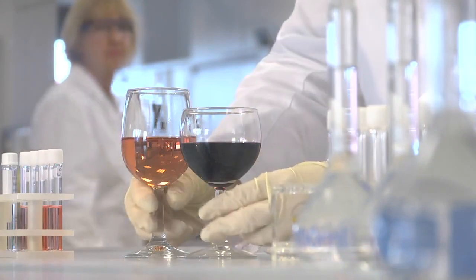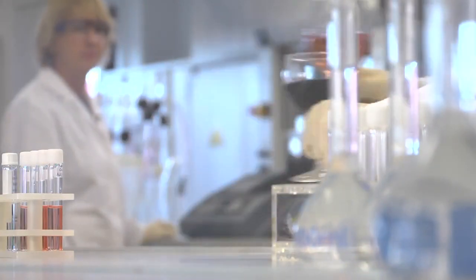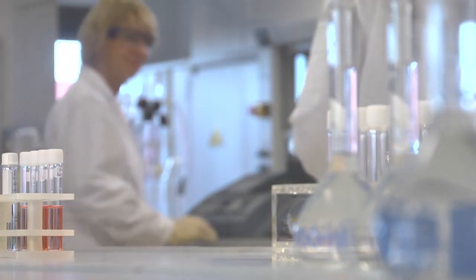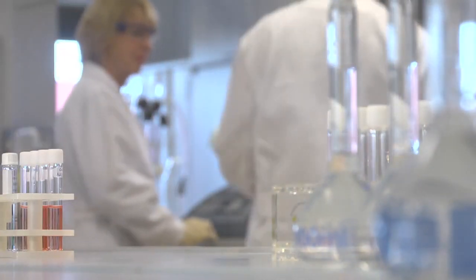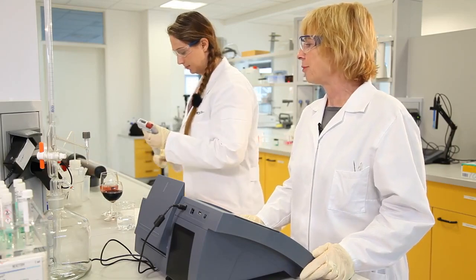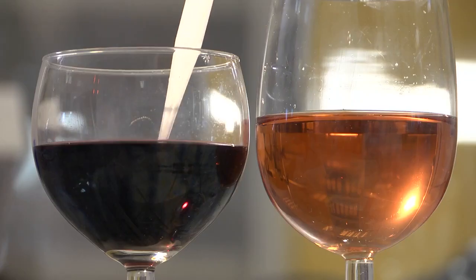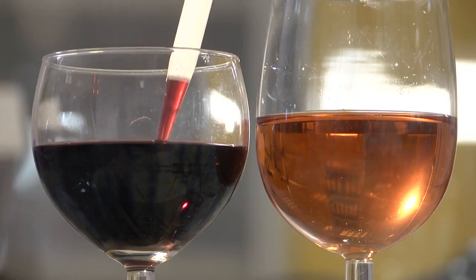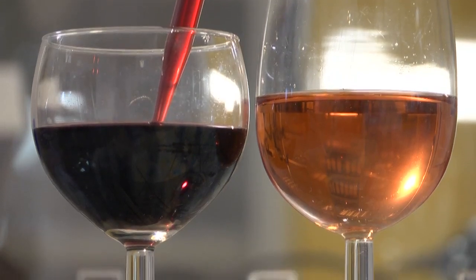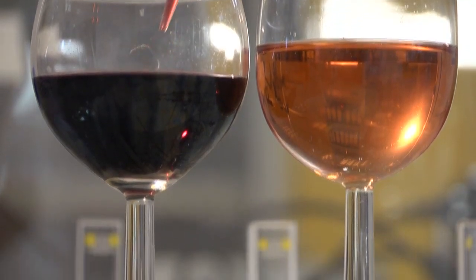In wine analysis, color is an important quality characteristic. It is used by bottling companies for quality control of incoming goods and is used by wine producers to characterize the wine.